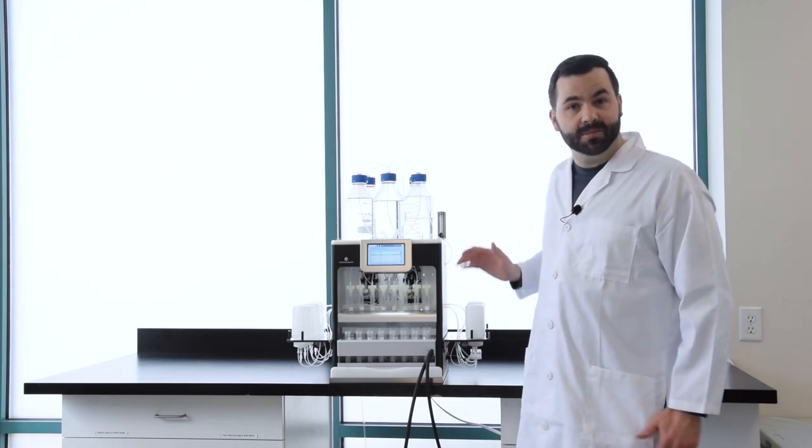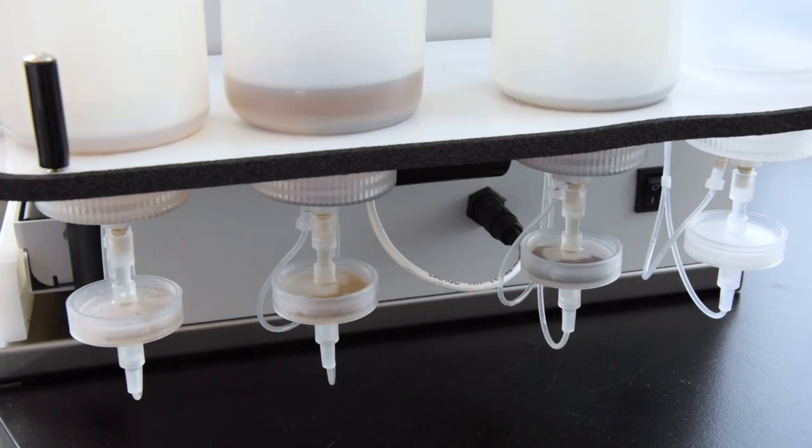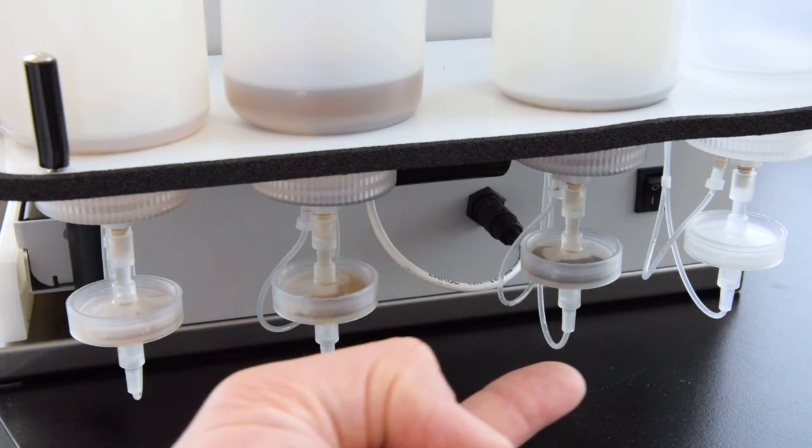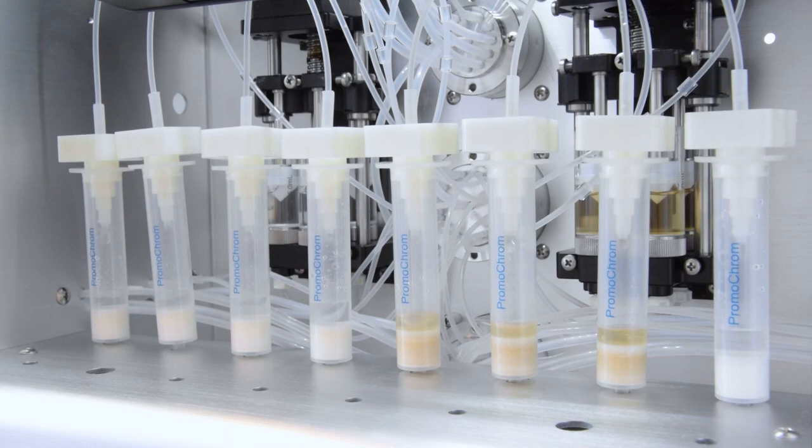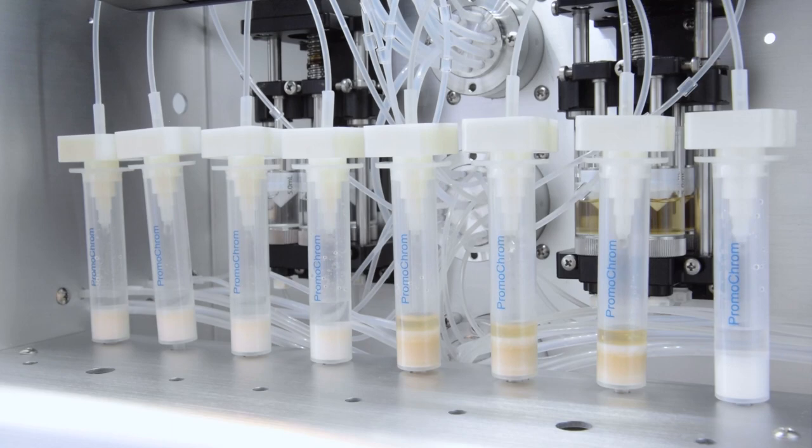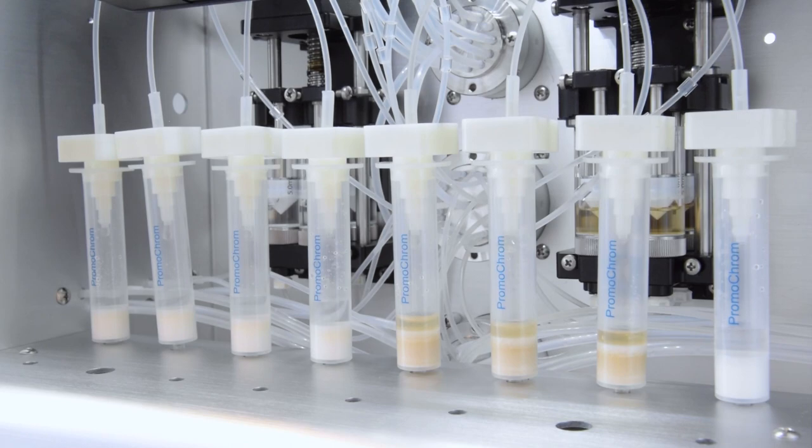It's been 60 minutes, and we're just about done with the sample loading. Checking on the inline filters, they've caught a considerable amount of particulates, especially with increasing soil content. Now looking at the SPE cartridges, the ones with soil are more discolored, but the liquid levels are no higher than our clean samples. This shows that the inline filters have done their job to prevent particulates from clogging the cartridges.